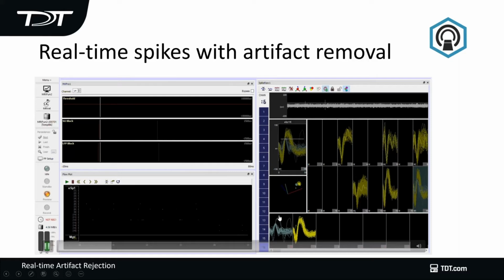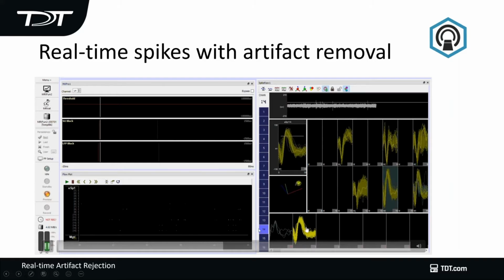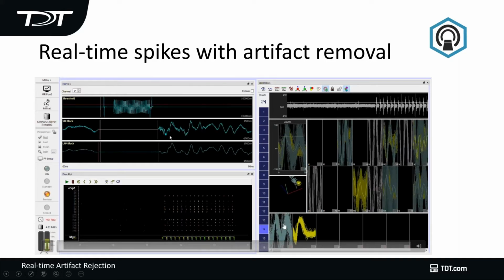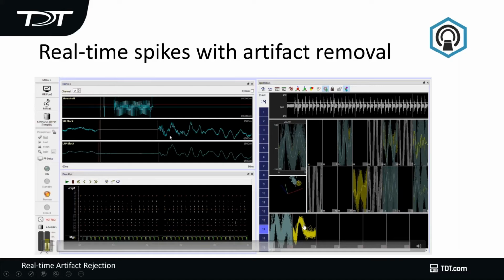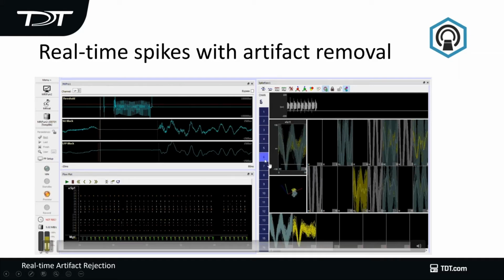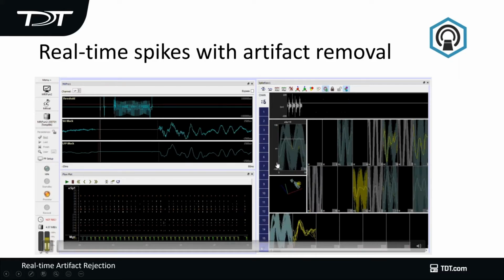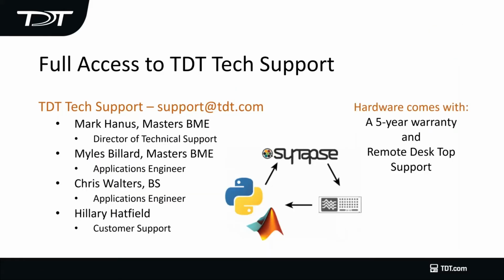This is a recording with the artifact rejected, and these are neurons that are being picked up. And right about now, we're going to start to see the artifact. You can see that the artifact rejects most of the spiking activity, but I can still see neural activity within my recording. So I can actually look at firing patterns of the neuron during the scan. Those are the three things that TDT does and provides you with the ability to do integrated electrophysiology and fMRI.